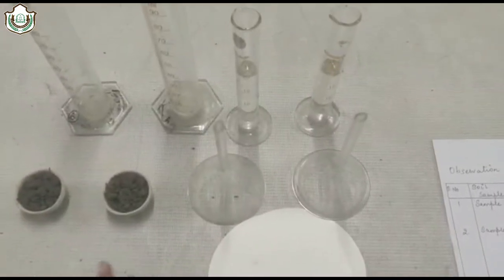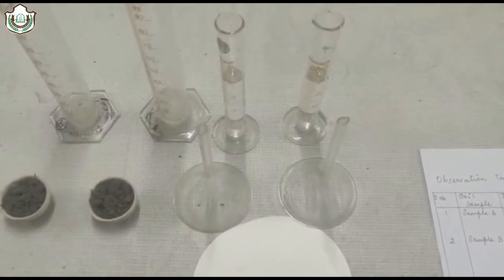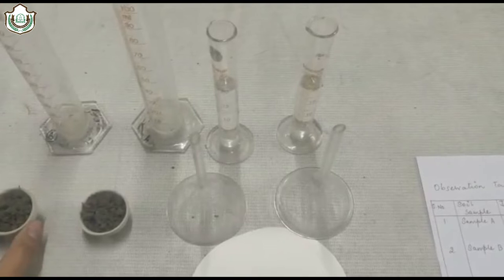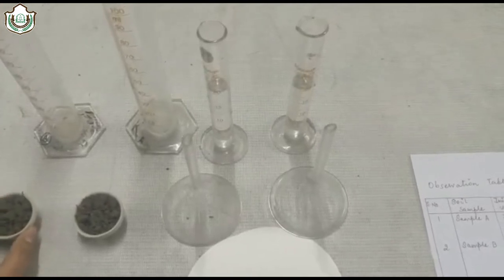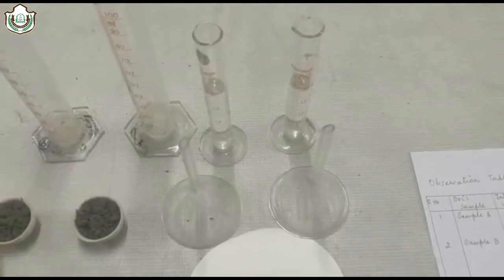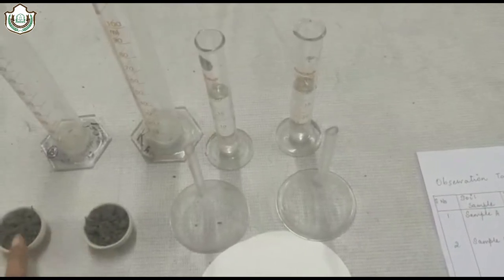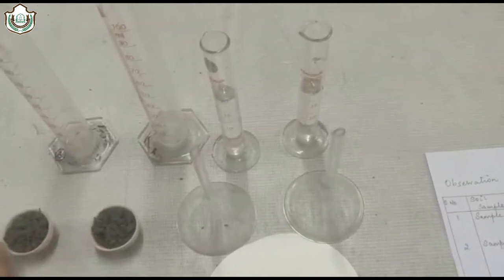Good morning all of you. Today we are going to study the water holding capacity of different soil samples. For that, we have required soil sample A and B. We have to measure the soil samples. Both soil sample A and B are of 20 grams.